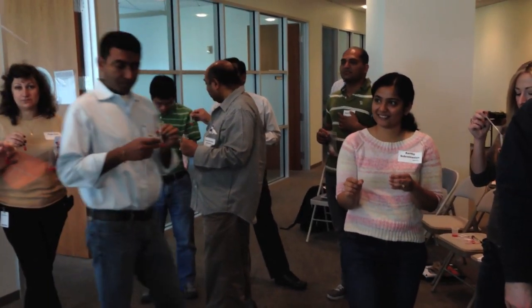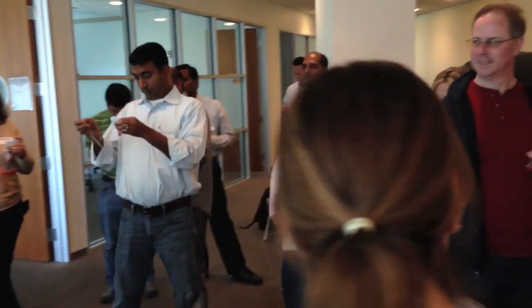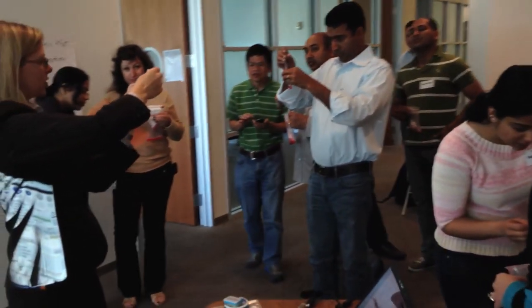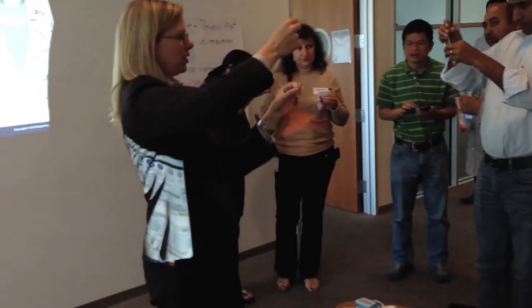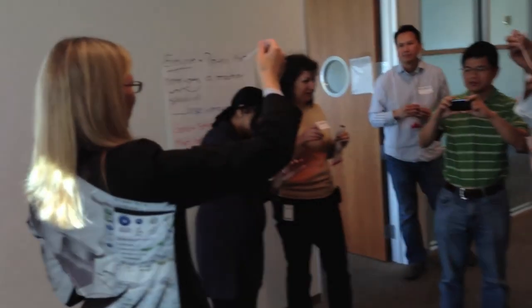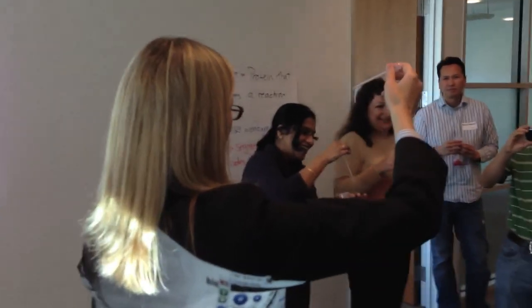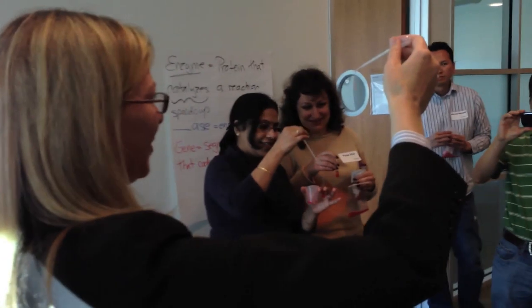If you want to touch the DNA, here's what you do. DNA is actually pretty sticky to plastic, so use your pipette, but you don't even need to squeeze it - just kind of use it as a hook. So you go ahead and if you just touch it to the DNA, you can pull the DNA out. Ah, that's a piece of tissue. No. There's my long string of DNA. I did it on this one.